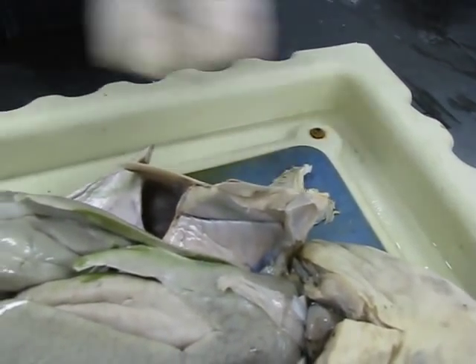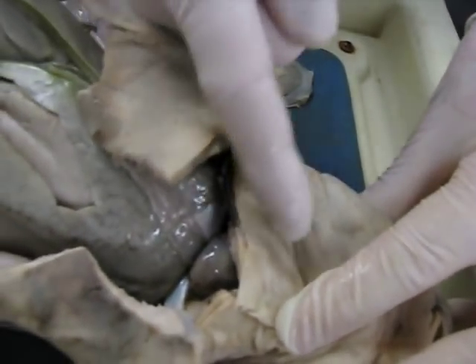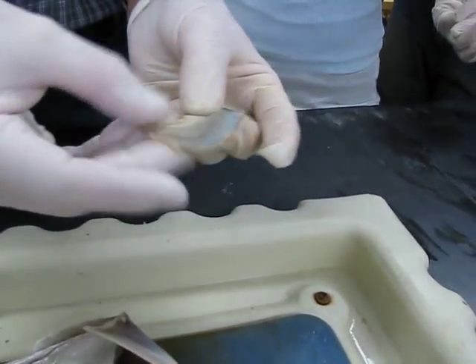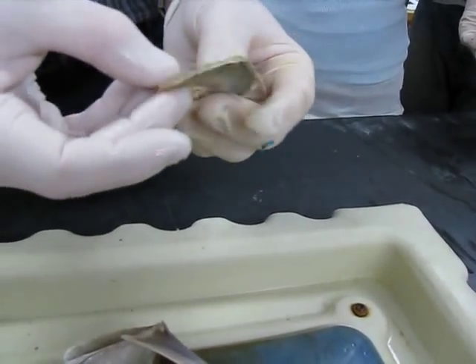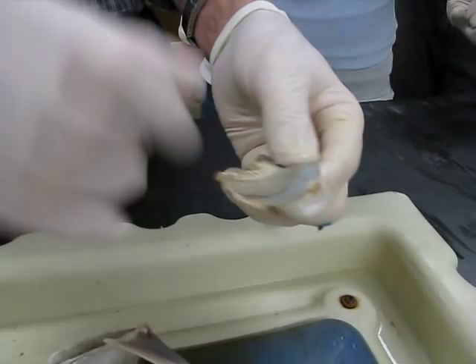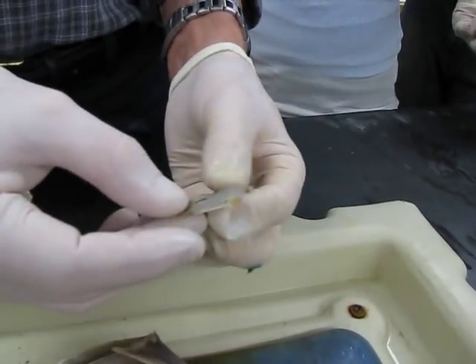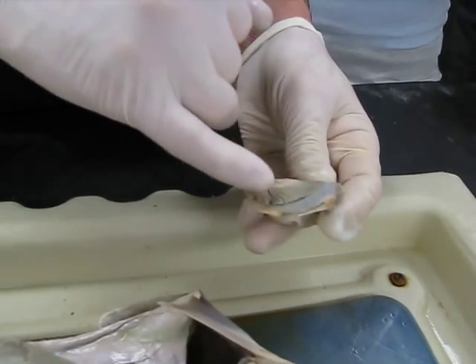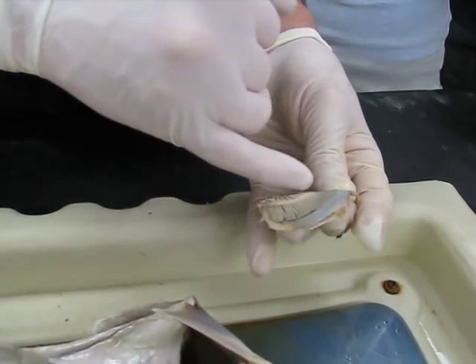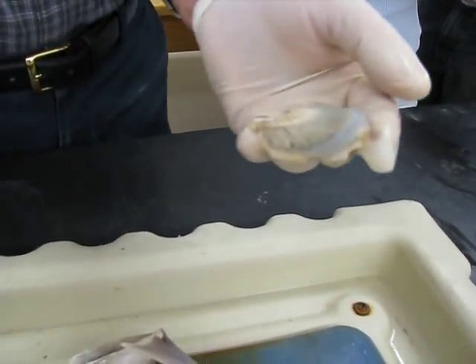Then gill. Did you dissect out a gill? Here's a gill completely pulled out. If you take your scissors and go into a gill slit and cut completely between two of them and excise it, what you're left with is this. The terms you need to know include gill arch — this arch-shaped structure on each side. Then there's the gill rakers, which are these teeth that look like a rake. The gill itself is the actual respiratory structure and they're composed of lamellae — primary and secondary. Each one of those projections is a primary lamella, and all those side extensions would be secondary lamellae.